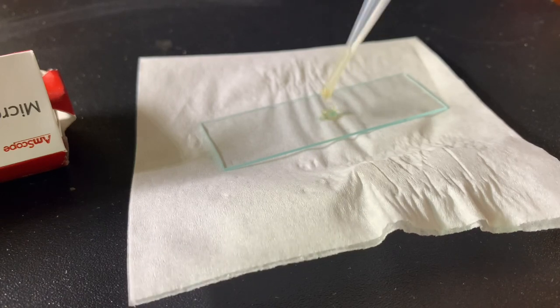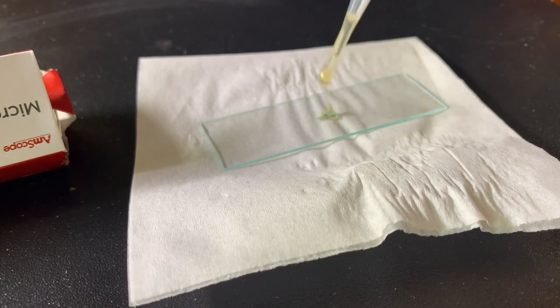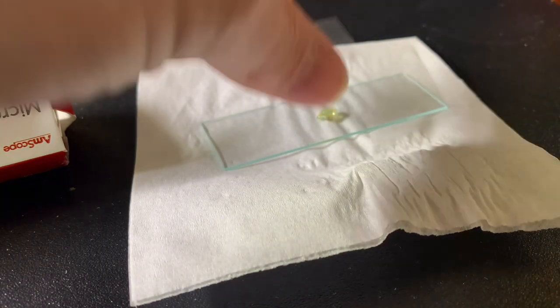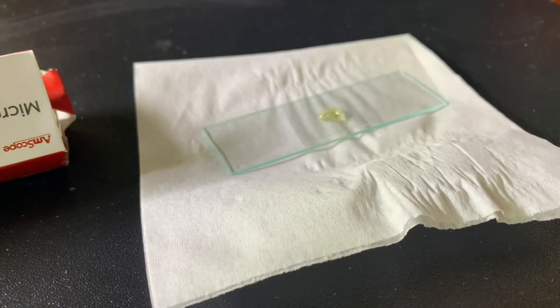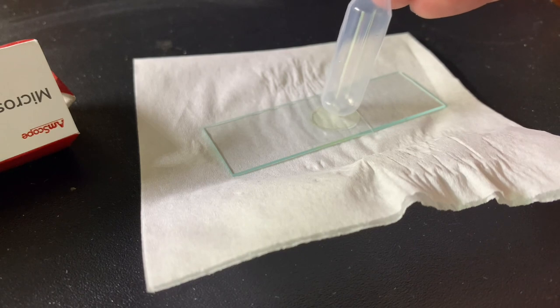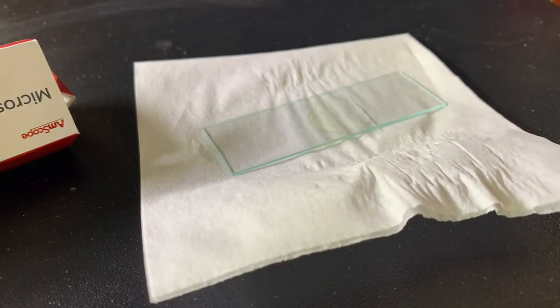So we're going to start off with what I imagined to be the most exciting thing, which is the raw, unfiltered honey that came locally from Utah. I'm just putting some on a slide with a glass coverslip that I'm going to flatten here to kind of make everything level, and we're going to look at it underneath the microscope in just a second. Most of you probably know where honey comes from — it comes from the nectar of flowers that is gathered by bees. Let's go ahead and take a look at this honey.